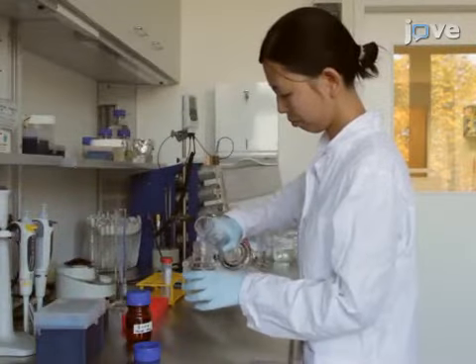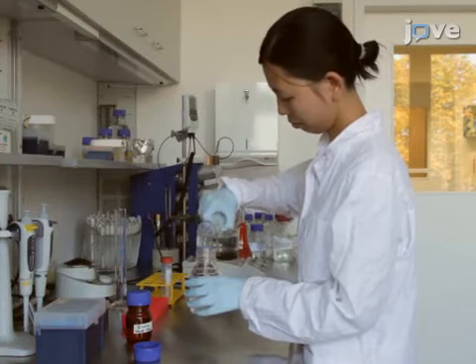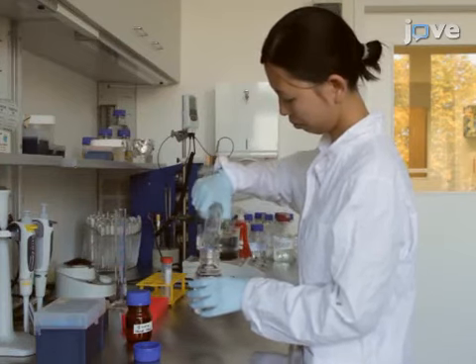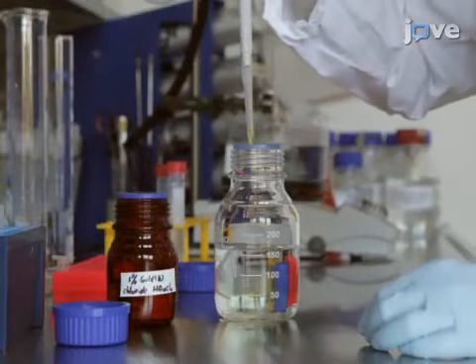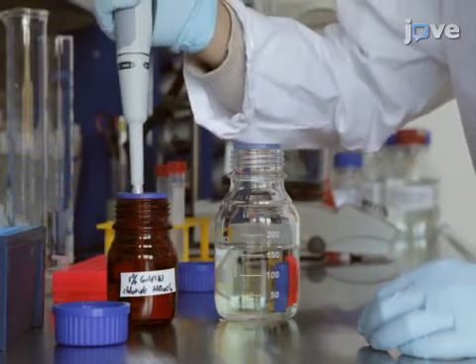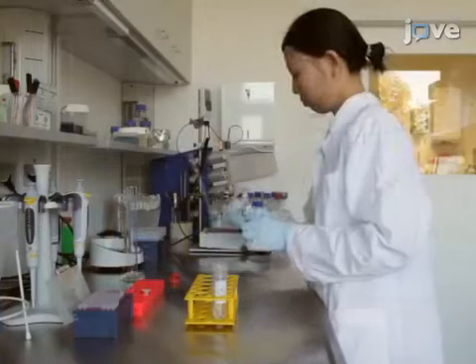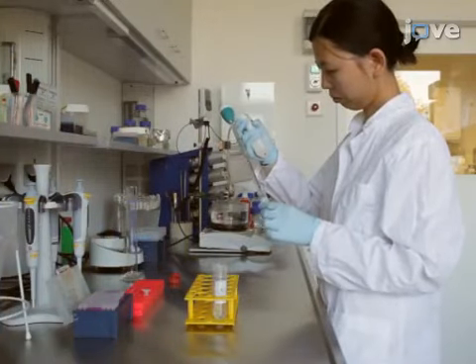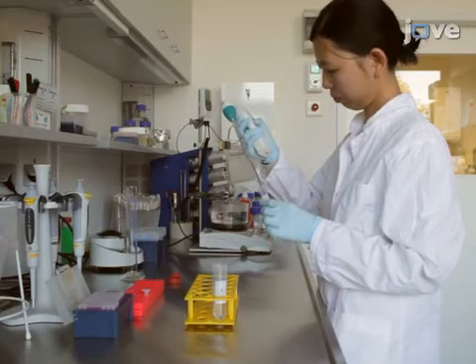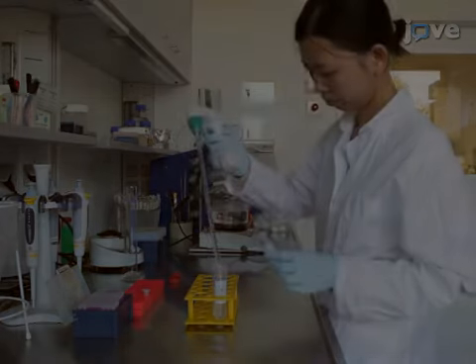The synthesis of 10 nanometer gold nanoparticles, or NPs, requires two solutions, solution A and solution B. To prepare solution A, add 2 milliliters of 1% aqueous gold chloride into 160 milliliters of milliQ water. Prepare solution B by adding 8 milliliters of 1% trisodium citrate dihydrate and 160 microliters of 1% tannic acid into 32 milliliters of milliQ water.